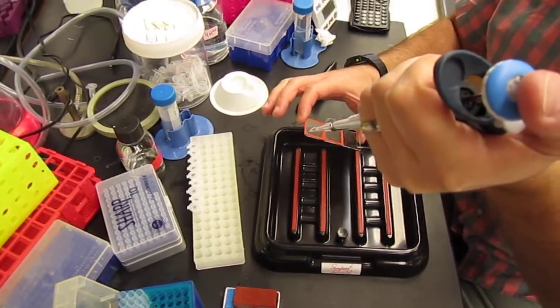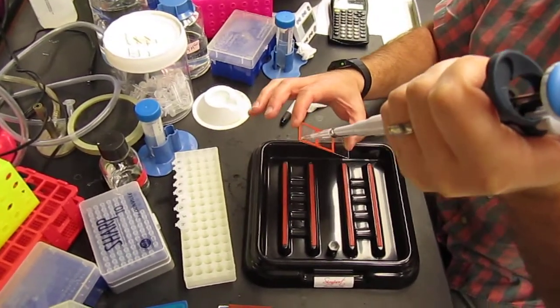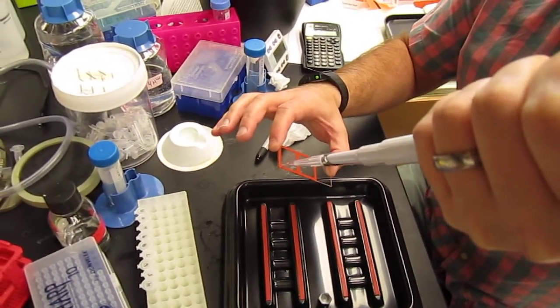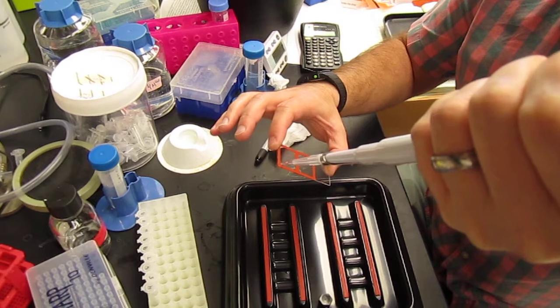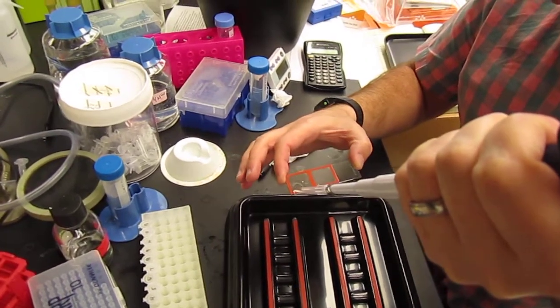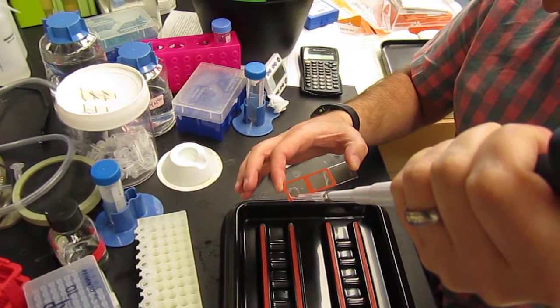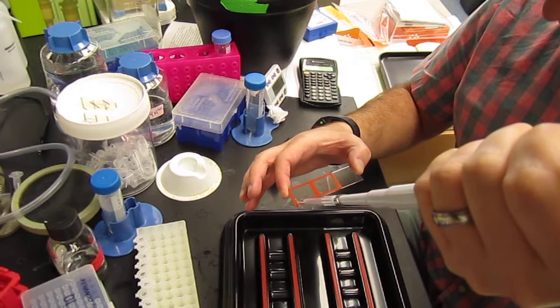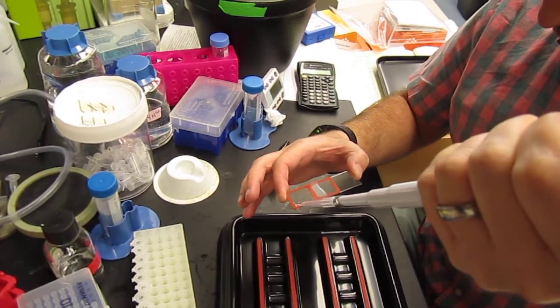From the top to the bottom. You want the liquid to go down to the bottom. Once it reaches the bottom, you want to push the liquid to the upper right-hand corner away from the lower port.